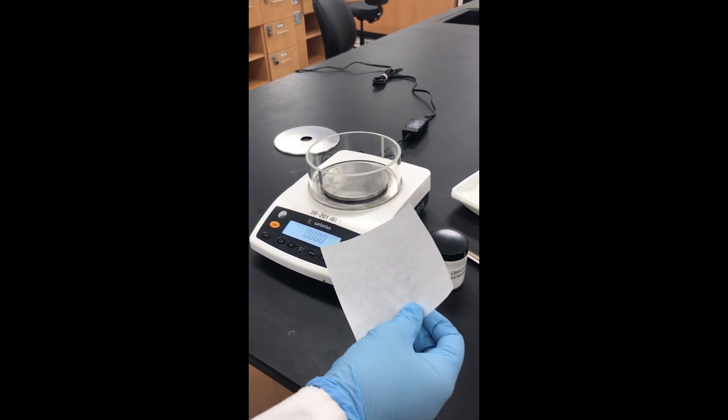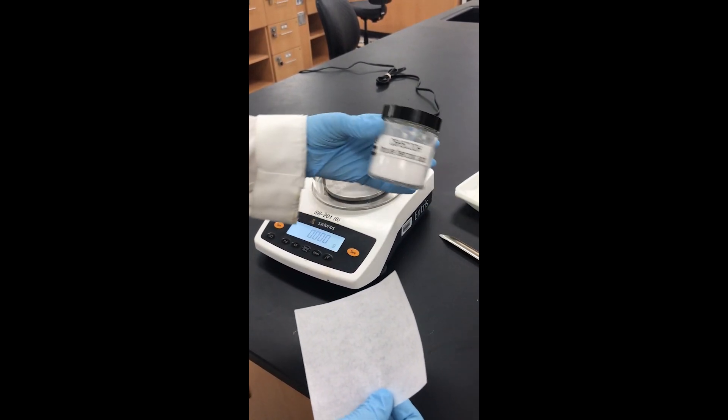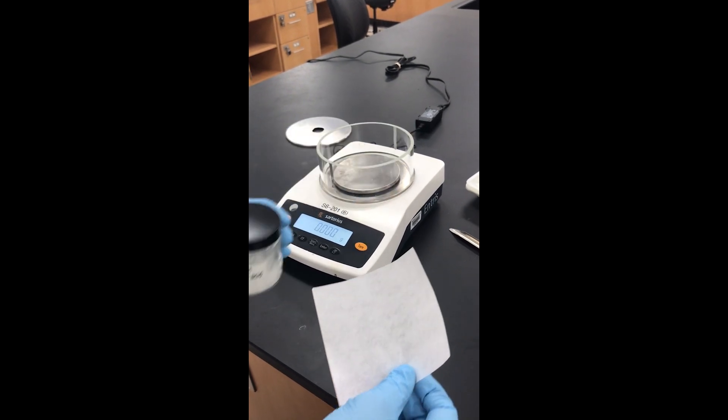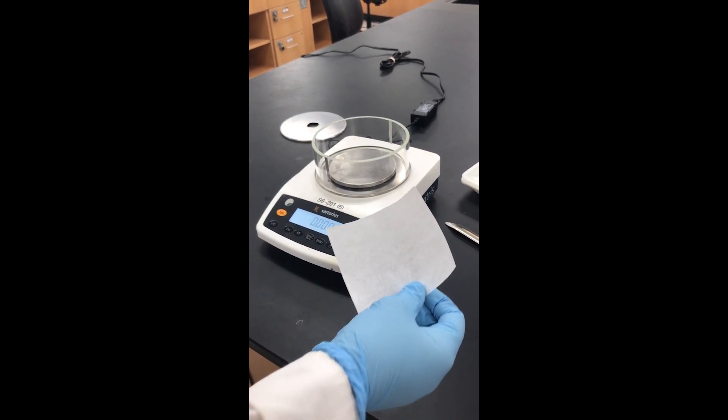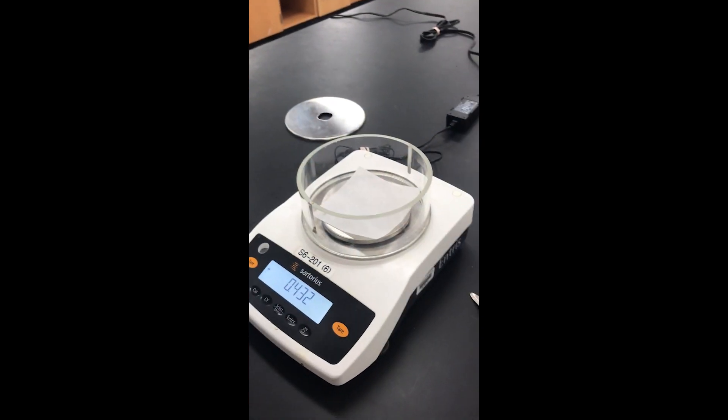Okay, this video is going to be on how to do a recrystallization. For the demo, I'm going to recrystallize some impure benzoic acid. I'm going to weigh out the benzoic acid first using some weigh paper.